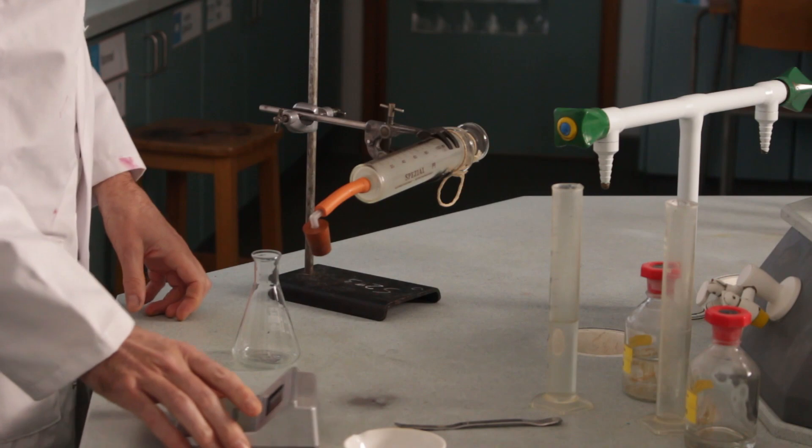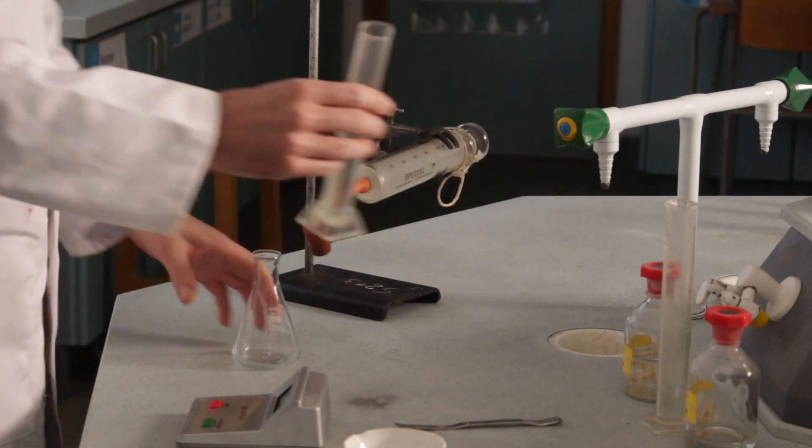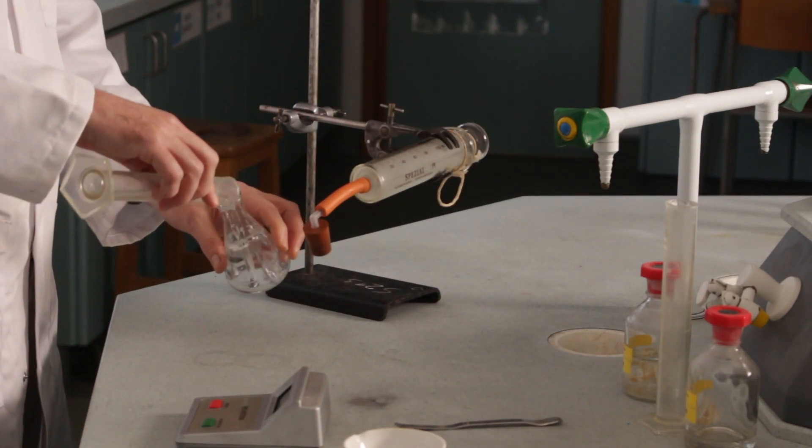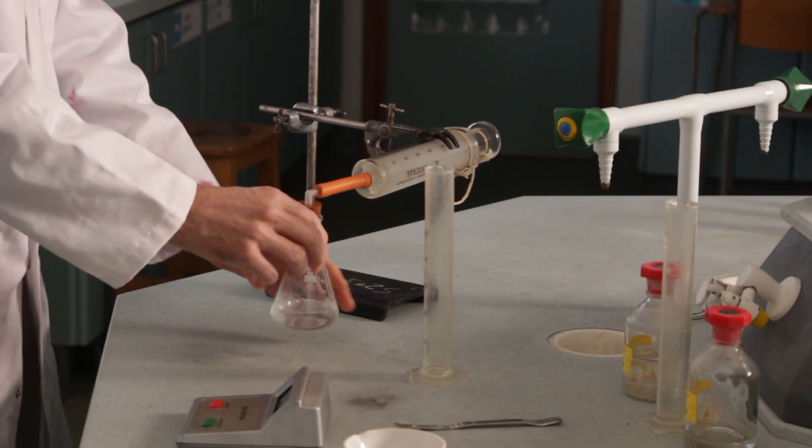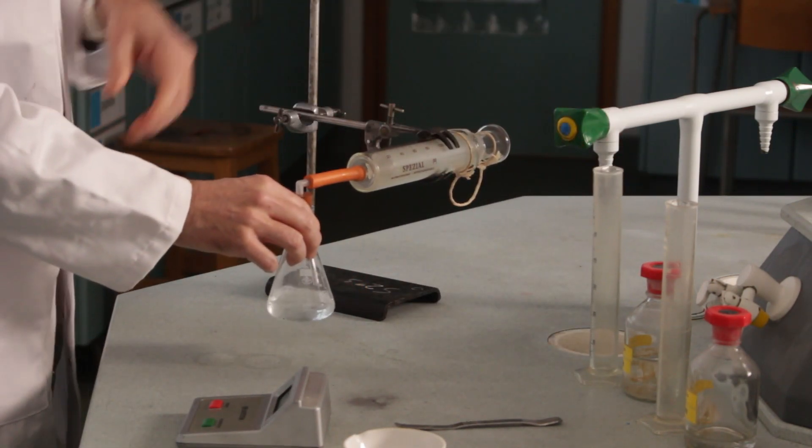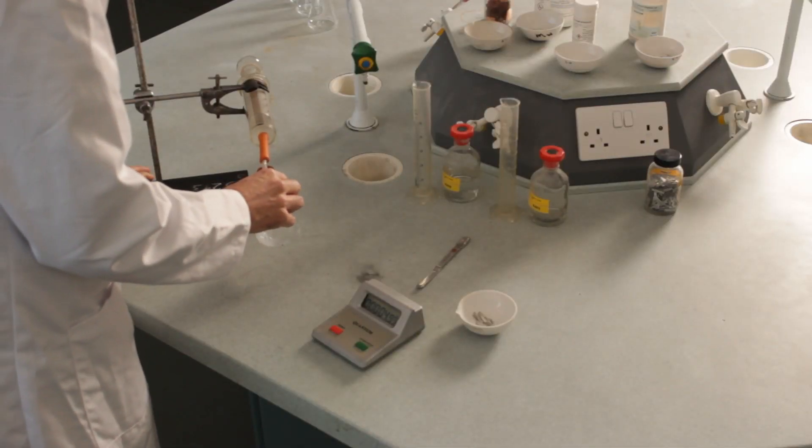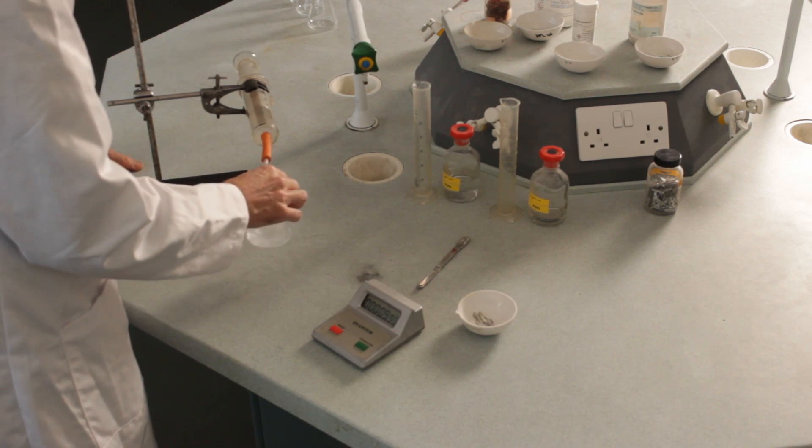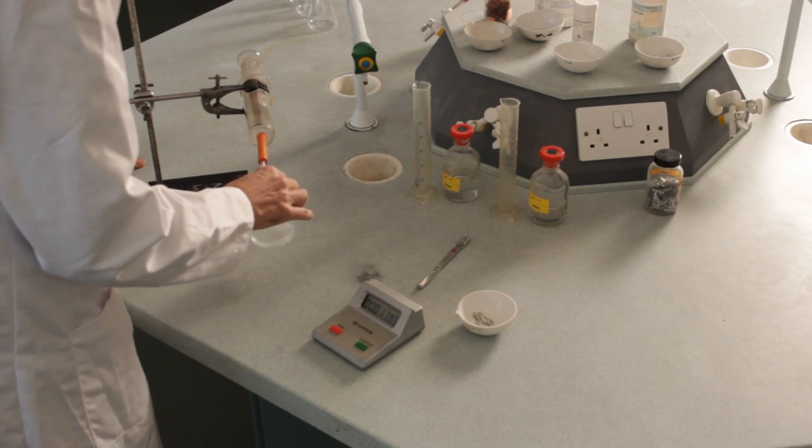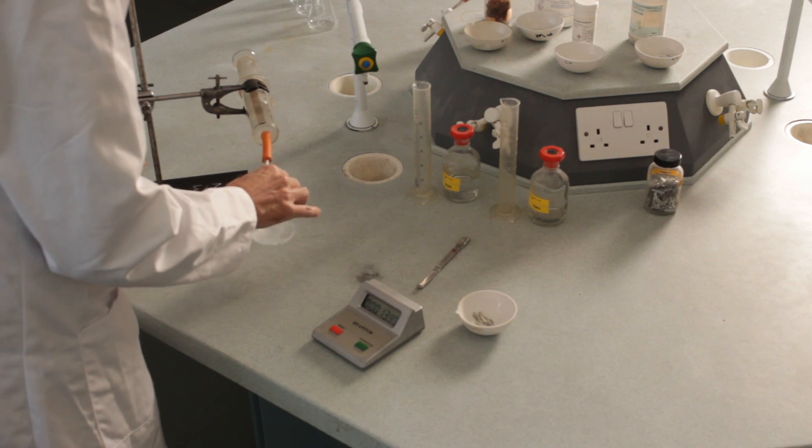As soon as I put this in the mixture, so there we go. It's in, that's on, stop clock on. And I don't know if you can see this, but it's racing away. That's 30, 40, 50, 60, 70. So I'm getting a bit of a problem here, aren't I? Because this is going almost beyond.